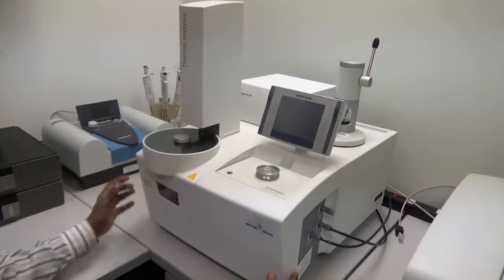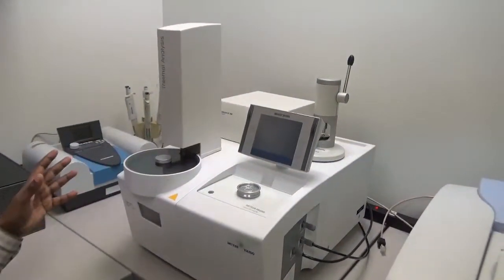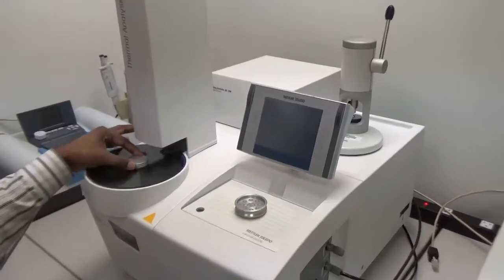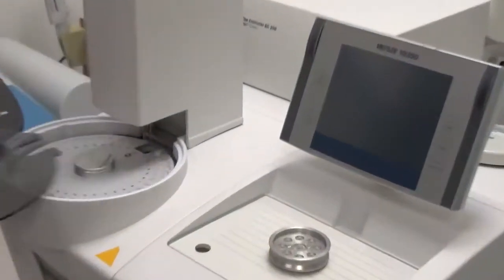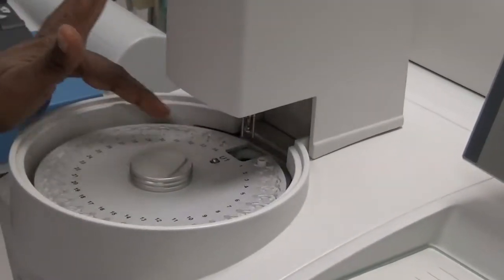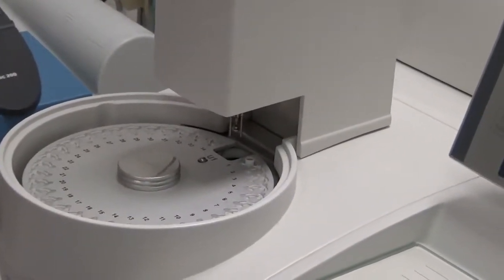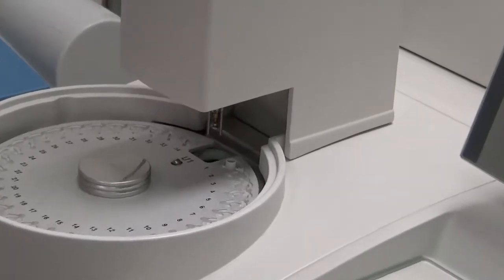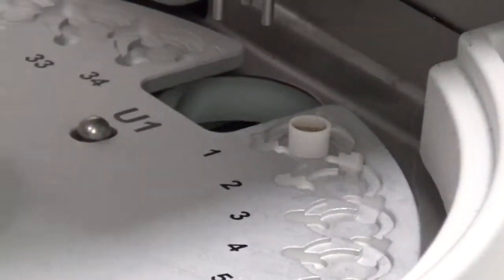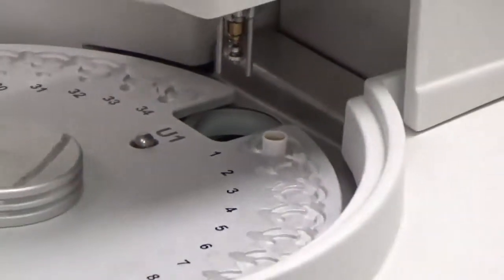This unit comes with a robot so we can do multiple sample analyses at the same time. We can place up to 34 samples in this robot, and it will determine the TGA and DSC scan of samples one after another, unattended.